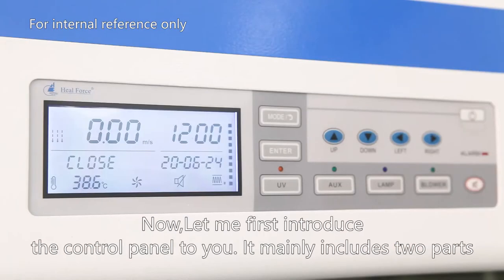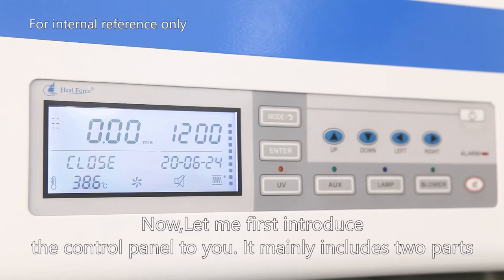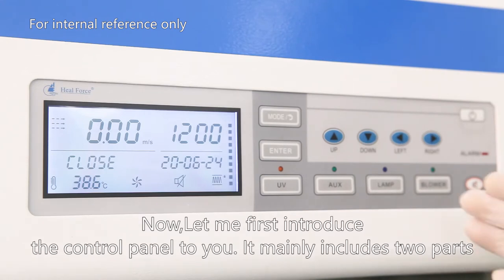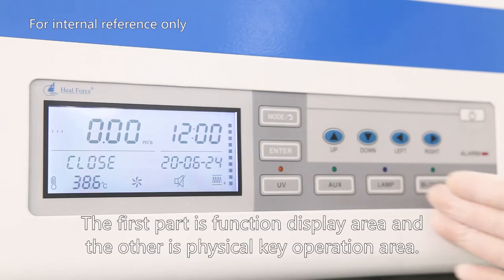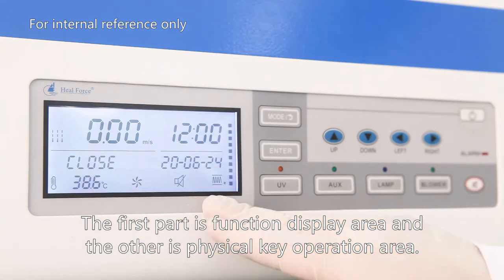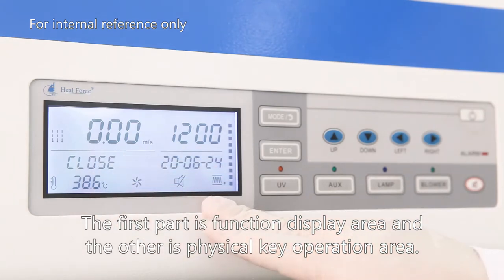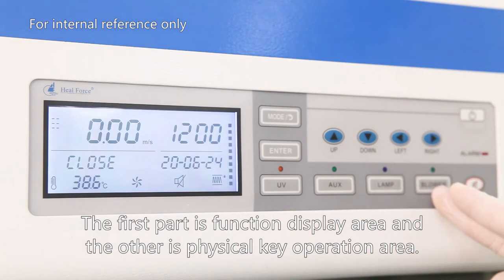Now let me first introduce the control panel to you. It mainly includes two parts: the first part is the function display area, and the other is the physical key operation area.